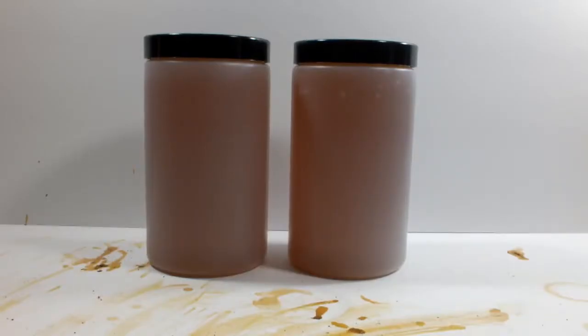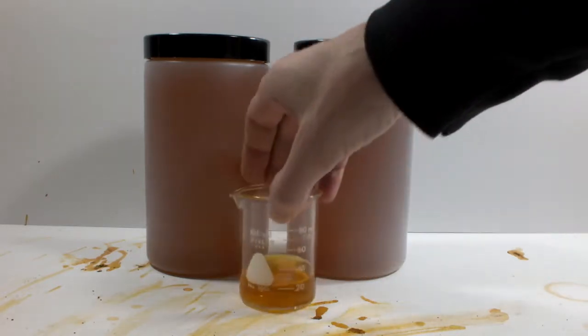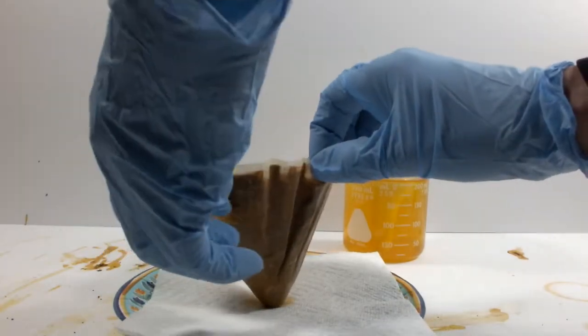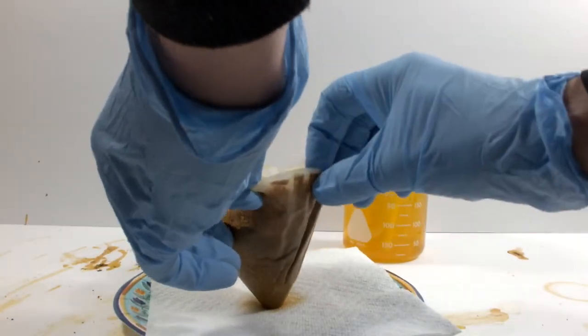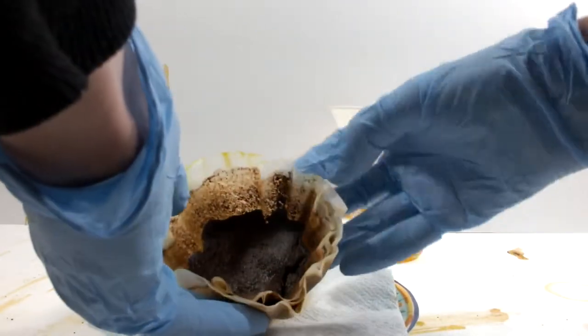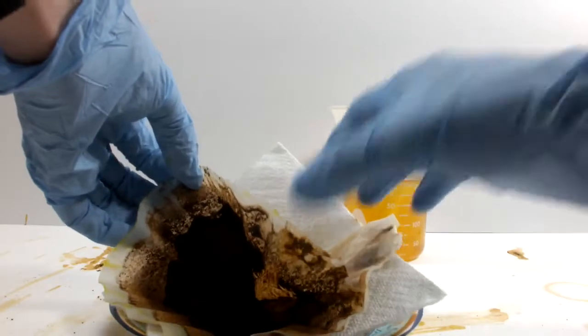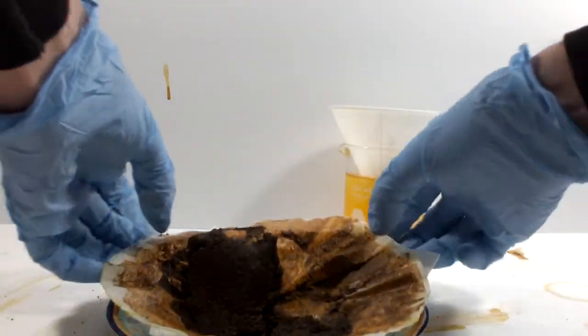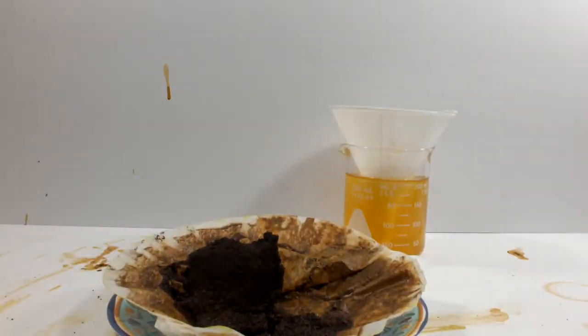Well, for starters, I filtered the wastewater and got 2 liters of a mixed iron 2, iron 3 chloride solution. A little more than 2 liters. Before long, all of the iron 2 in solution will oxidize to iron 3. There is also a whole bunch of brownish red iron 3 oxide that came out as a rather fine powder that was pretty easy to filter. Apparently it was a lot easier to filter than it is to get the filter paper open. Anyway, I'll let this dry, but I have no idea what I'm going to do with it.